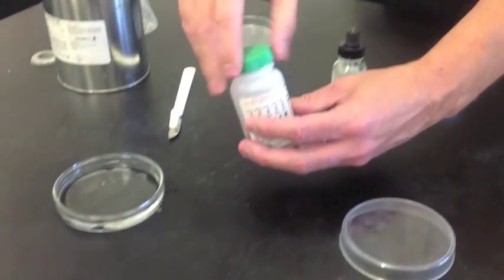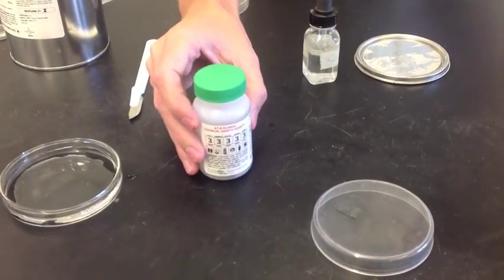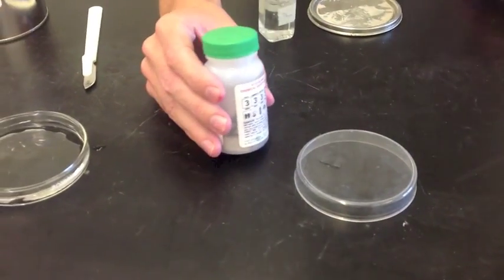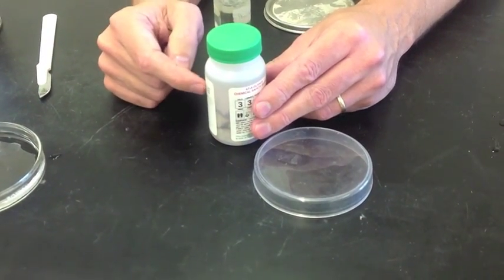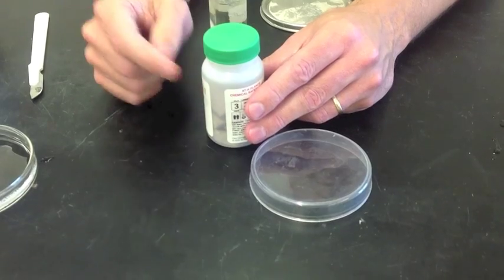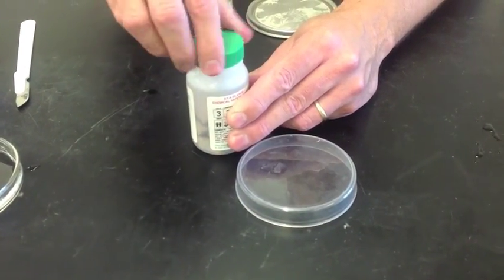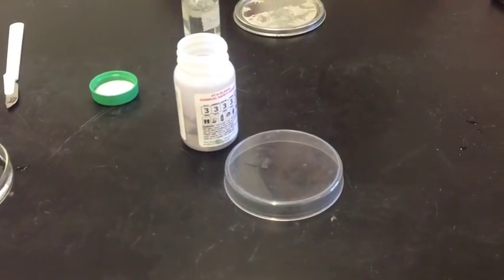Sodium comes in a container that is filled with oil. And the reason it's filled with oil is because we want to protect the sodium from moisture. We know that oil doesn't like moisture. So I'm going to take a piece of sodium out.